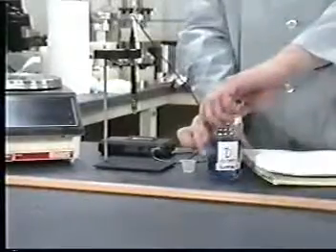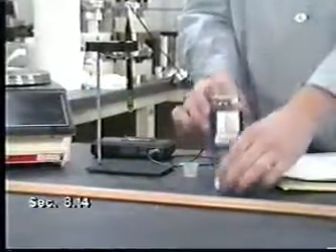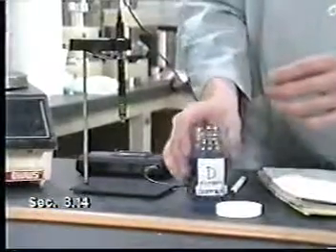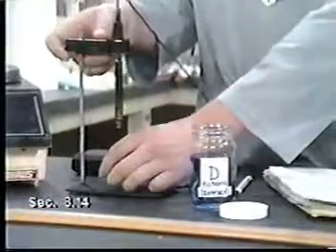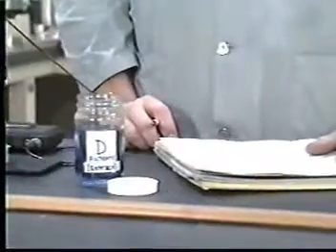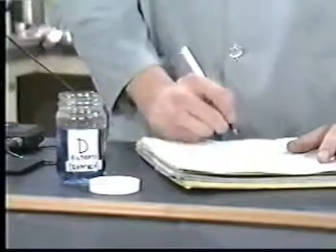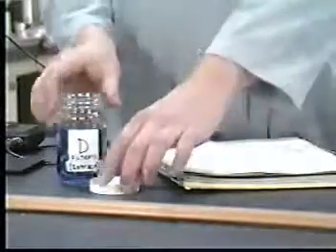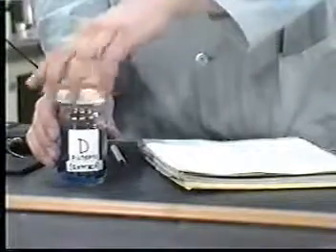Once the TCLP extract has been obtained, measure and record the pH. Samples should immediately be aliquoted for analysis. Before storing metallic aliquots, acidify them to a pH less than 2 with nitric acid. Other aliquots should be stored at 4 degrees Celsius until analyzed. Observe the storage time limit for specific analytes.